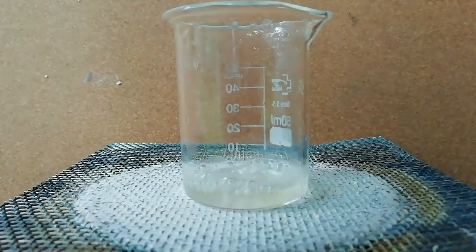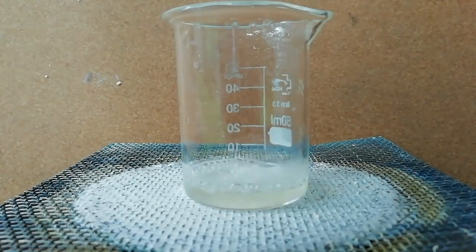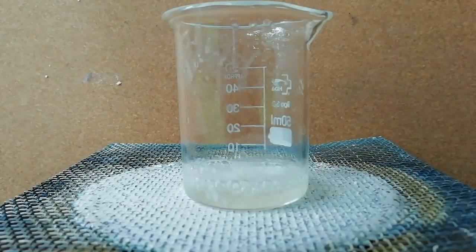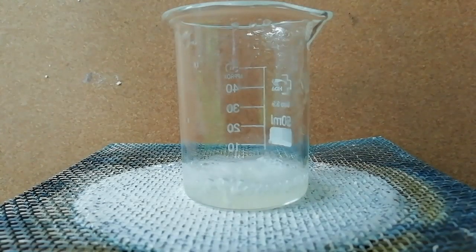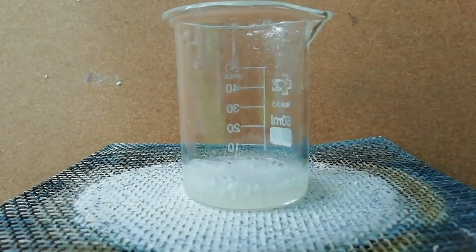When the volume reached about 10 milliliters, I transferred the liquid into a 50 milliliter beaker. After that, I kept heating the beaker until all the liquid was boiled off.